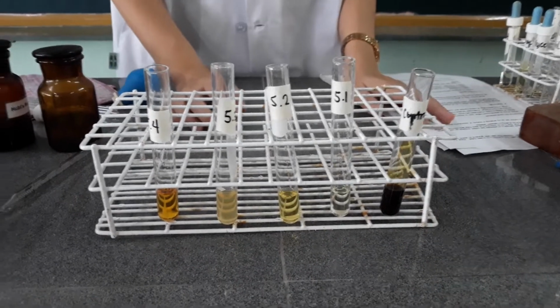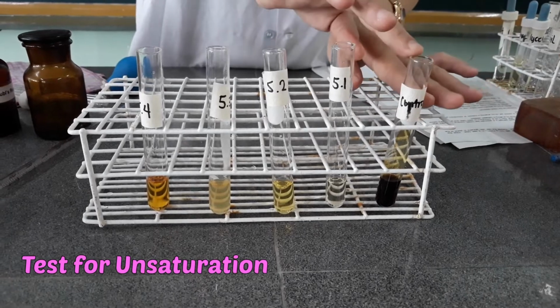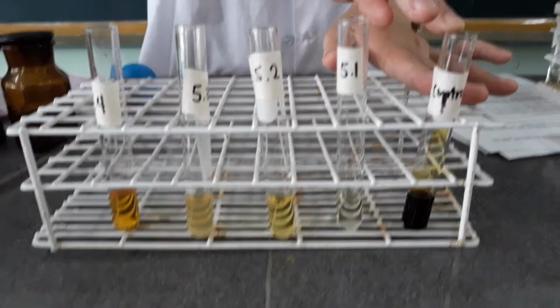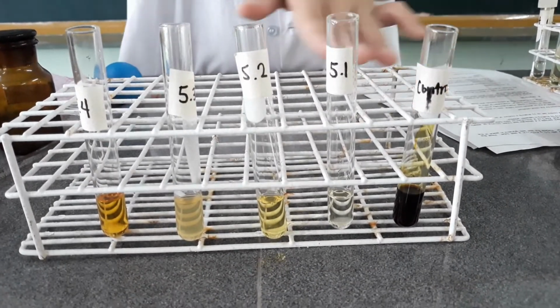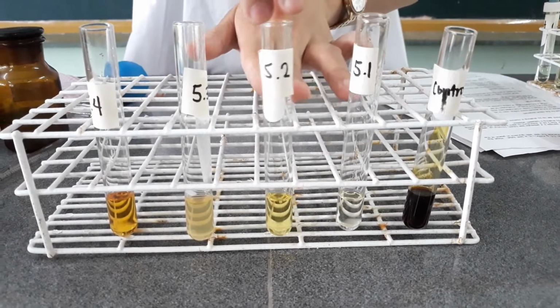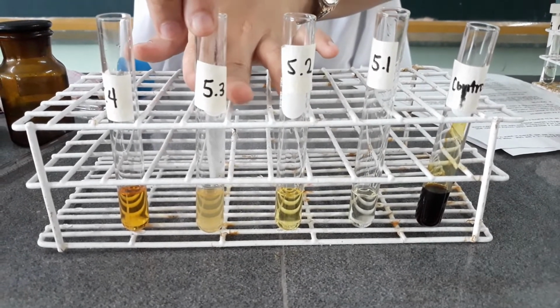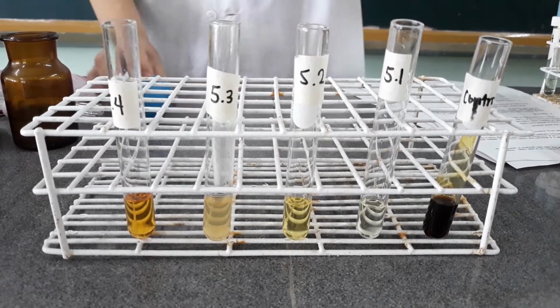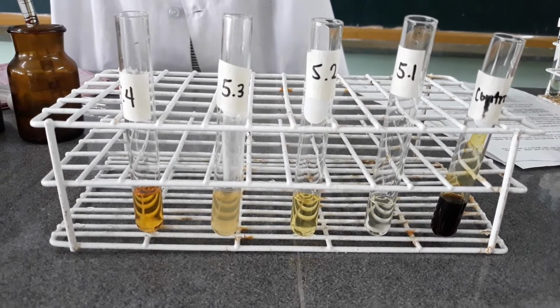Now for our fifth test, the test for unsaturation. We have the control test tube, which contains a mixture of chloroform and iodine reagent. The first test tube contains coconut oil. We have the stearic acid, the linseed oil, and the oleic acid. Now we are going to add 3 ml of chloroform to each of the test tubes.